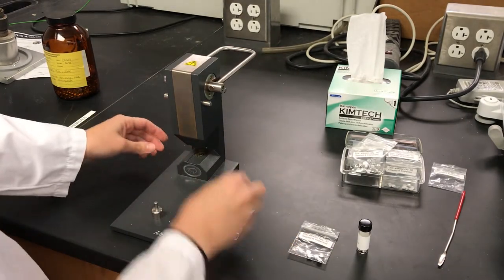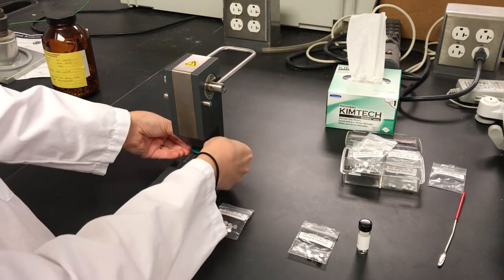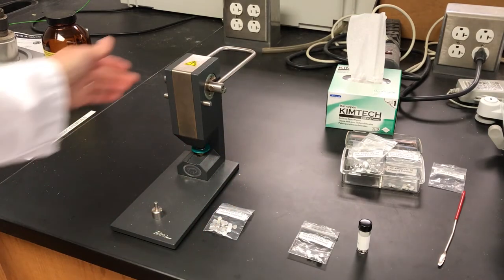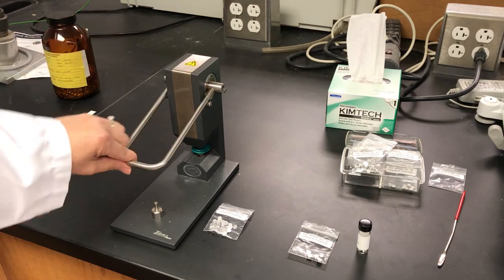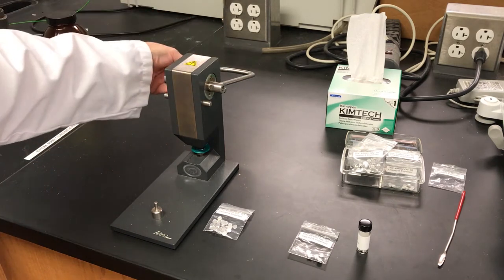This goes up in the top there and this one slides in the bottom. And in order to use the press, it's very simple. You just put the handle down. There should be very little resistance.